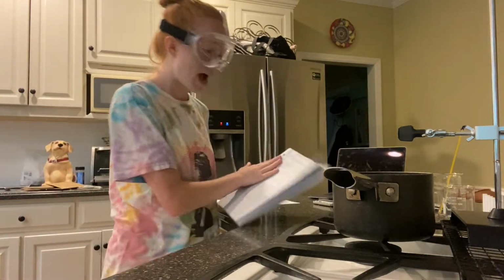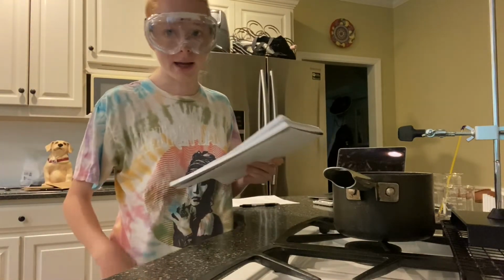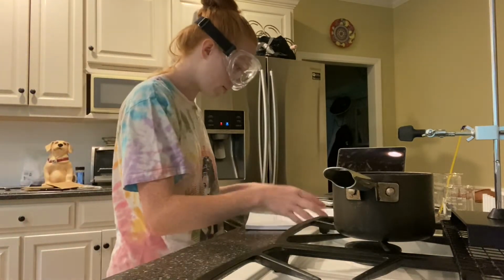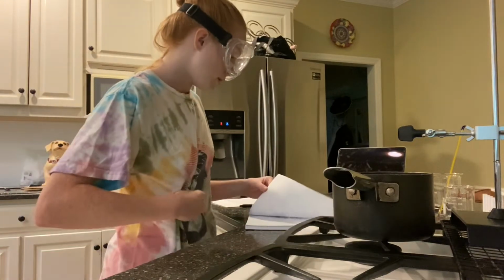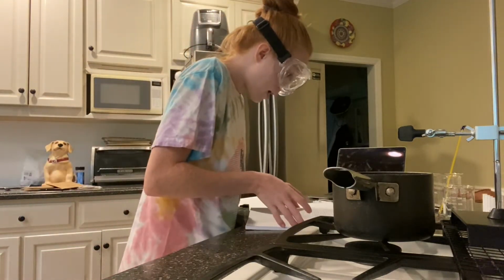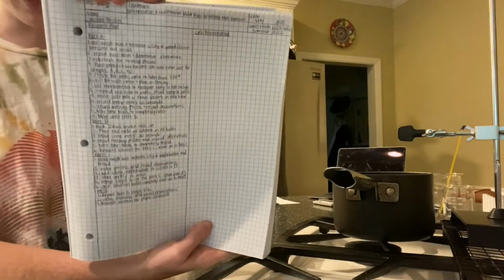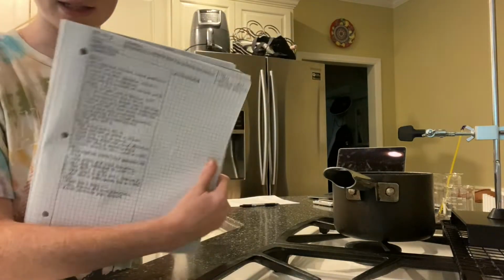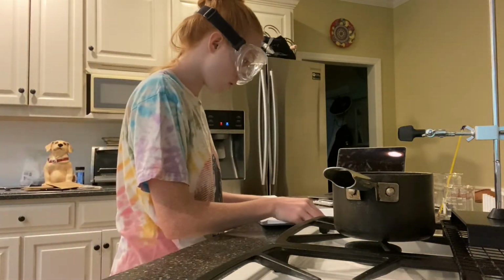I've done an SDS for each of those, and it is important to note that I'm wearing my correct lab equipment, and I will be handling those chemicals properly as such. I have done my research plan for this. My experimental side is blank currently. However, I will be filling that out as I go.